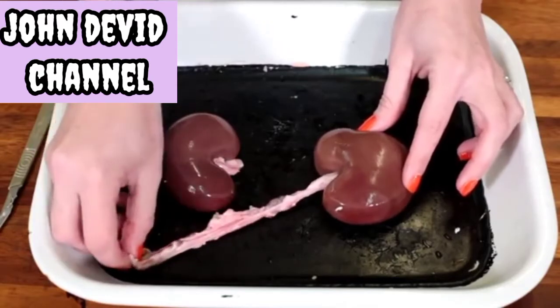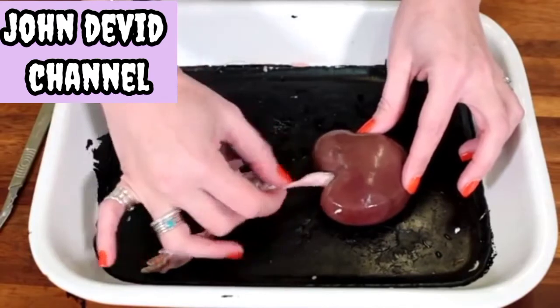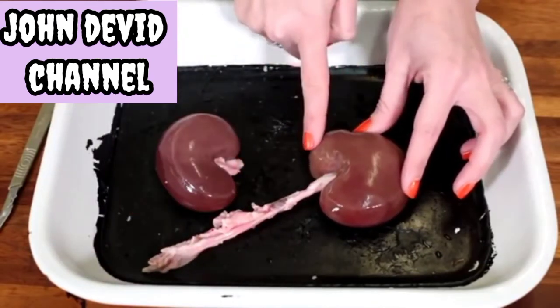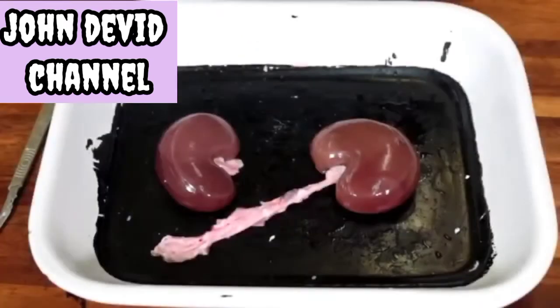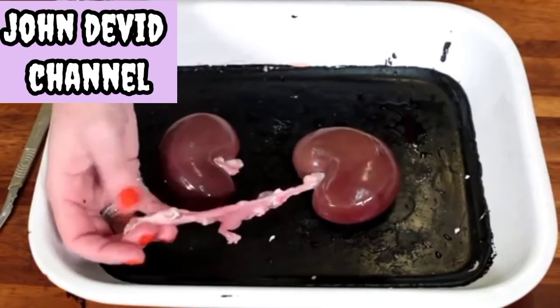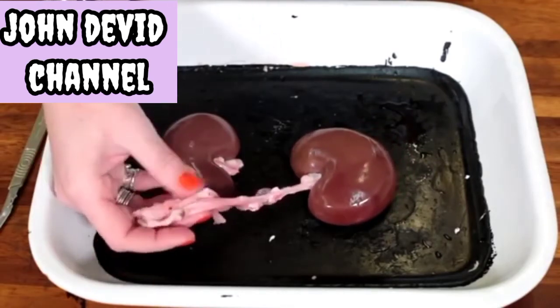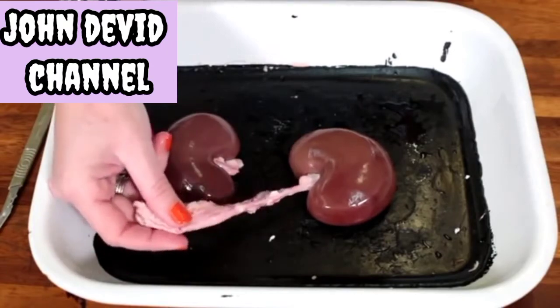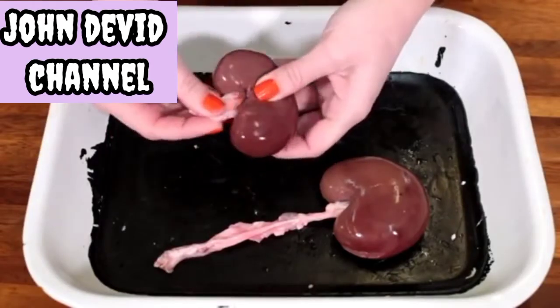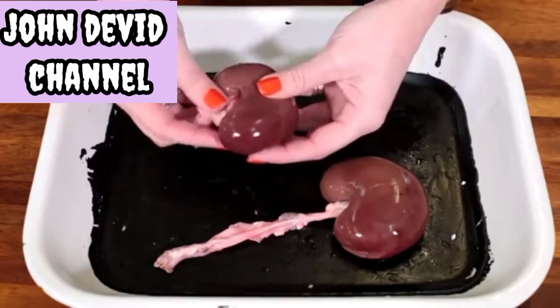The ureter, the renal artery, and the renal vein — each of which come out from the same middle section of that bean-shaped kidney. When identifying the vessels, the ureter will be the vessel most covered in fat. The artery will be the thicker and the vein the thinner of the vessels. On this kidney I have trimmed off the excess ureter, artery, and vein to make the dissection more straightforward.